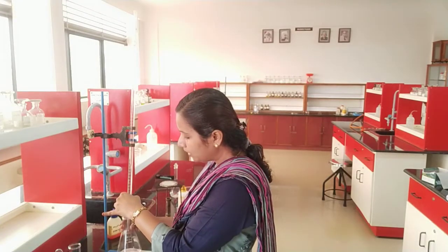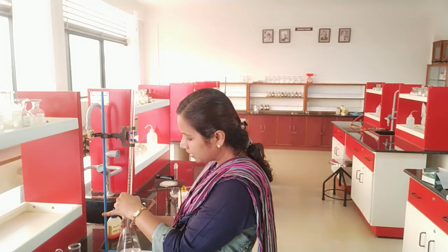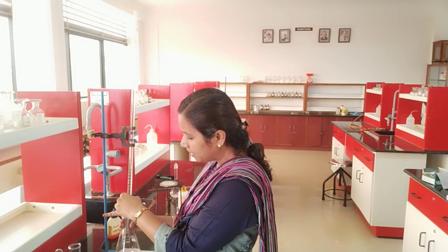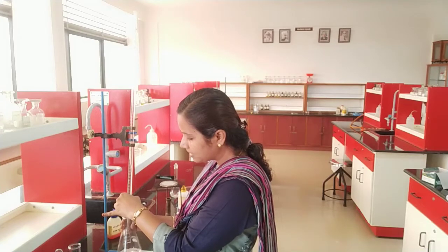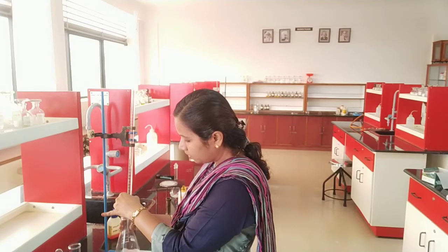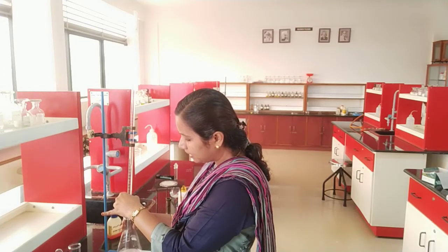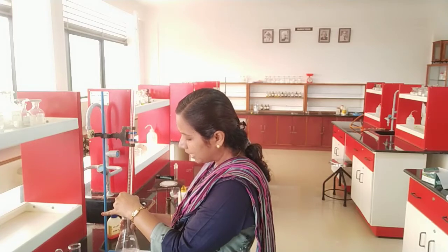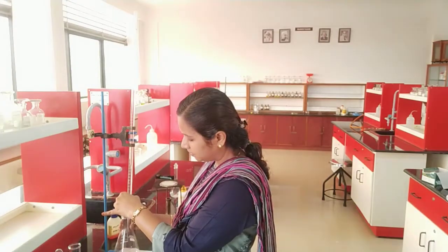While doing this experiment, we are supposed to do it in duplicates so that any errors can be avoided. But I am doing only one time. So you should prepare simultaneously two conical flasks and you should start your titration. Appearance of pale permanent pink color is the end point, that is your concordant value, and I will be helping in the calculation part during the live session.